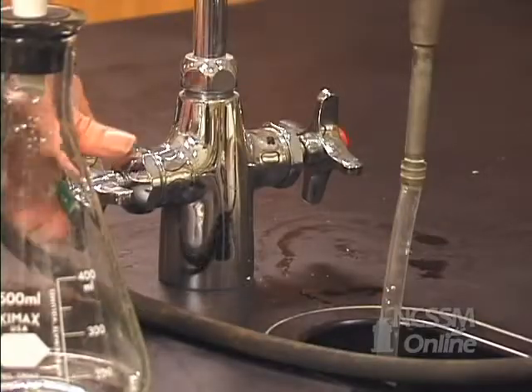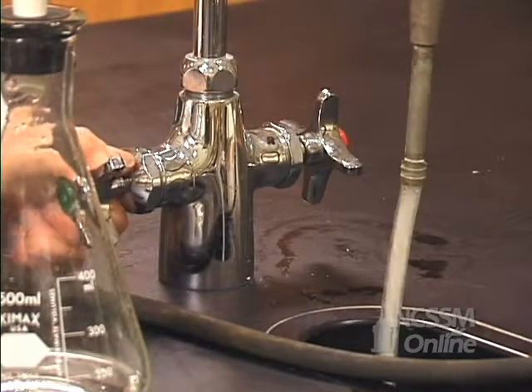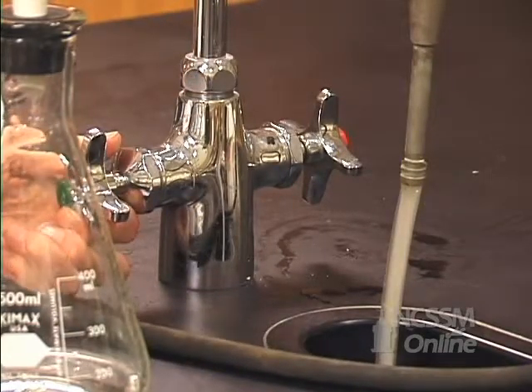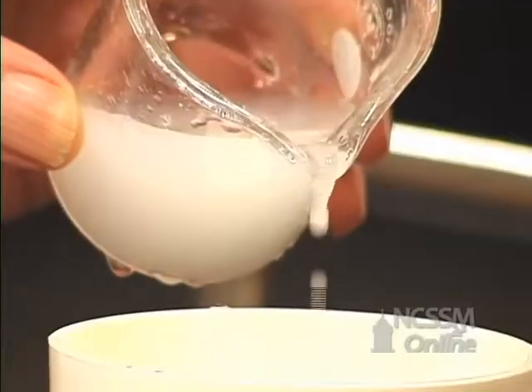Now we can turn on our aspirator and filter.